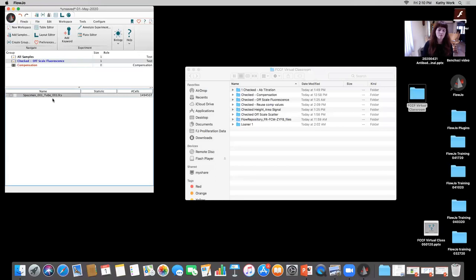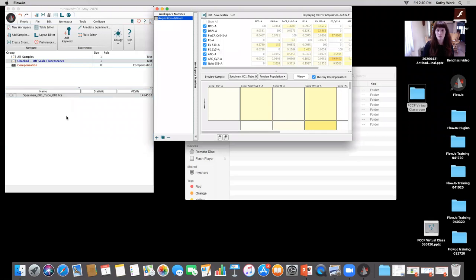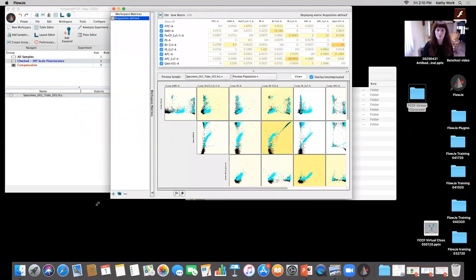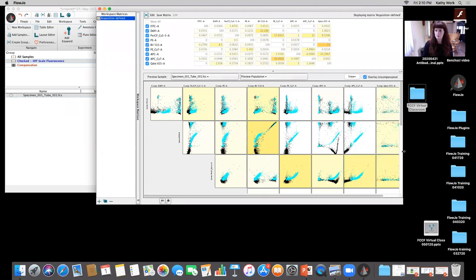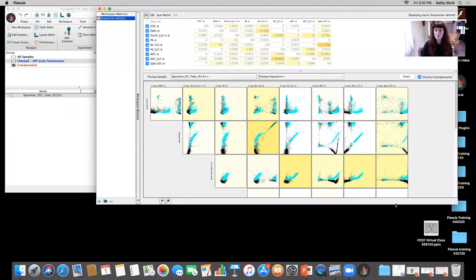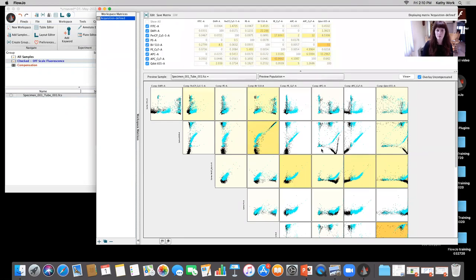And why does it matter, right? If my single color is on scale and everything looks good with it, but then my fully stained is off scale, right? There's going to be implications there with compensation and also for accurate determination of statistics. So if I take a look at this file and I double click on that comp matrix, this is from another experiment, what I immediately see is a mess, right? There are issues with this compensation.